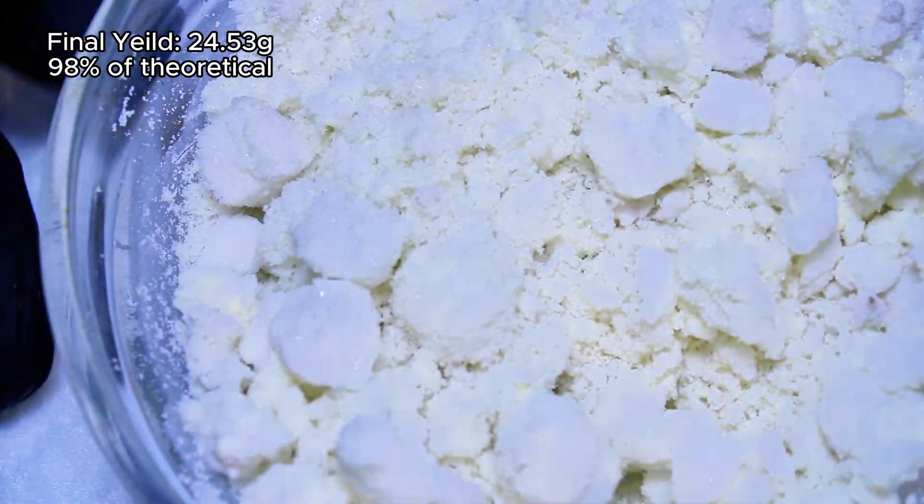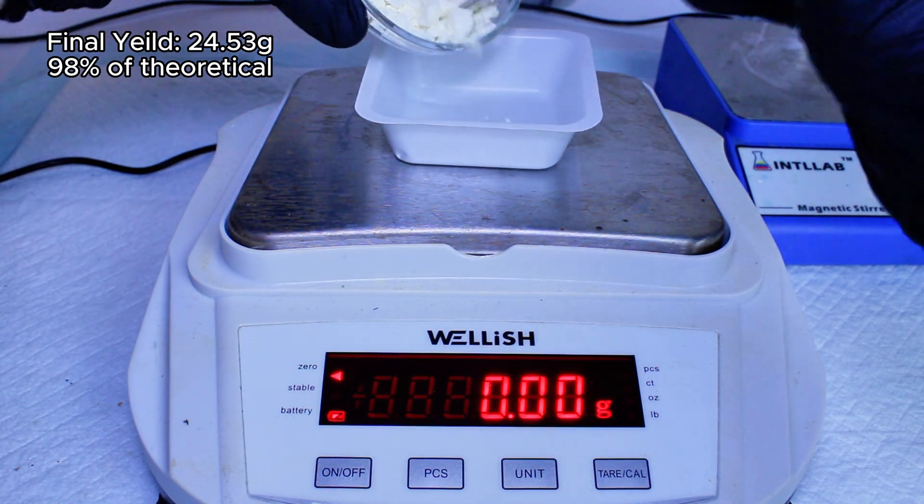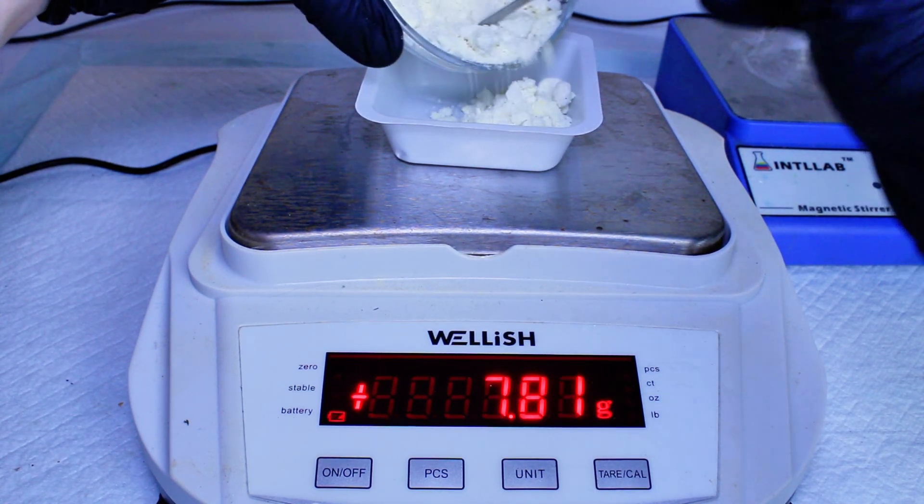Now, I haven't been able to find much regarding the synthesis of this compound, so I don't really know what the yield should look like, but given the simplicity of the reaction, it should be pretty high like this.